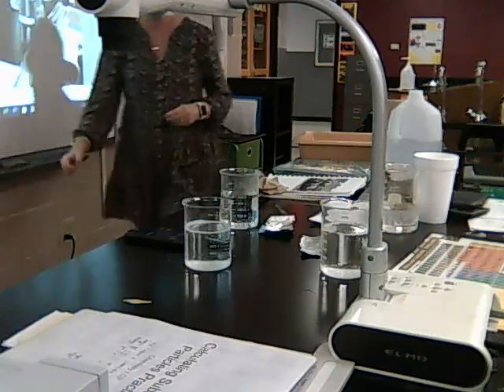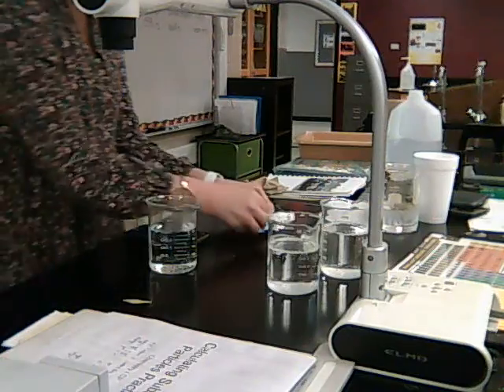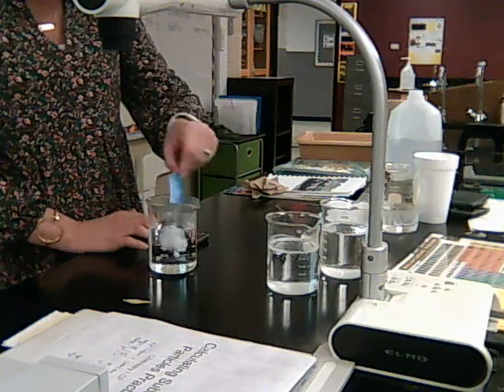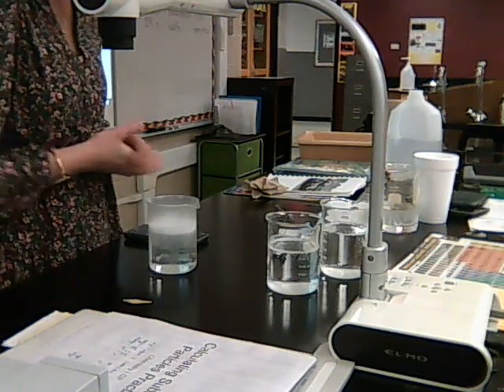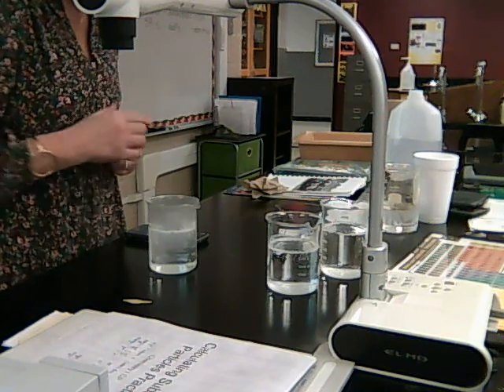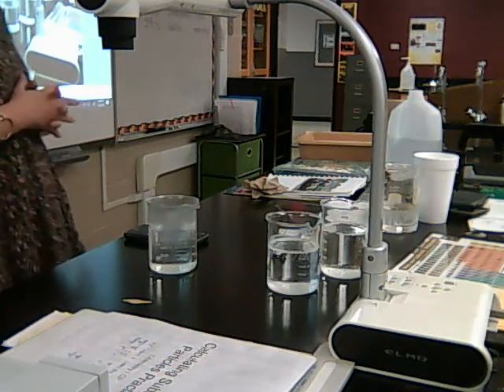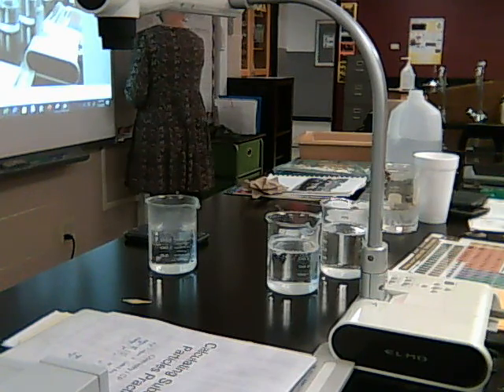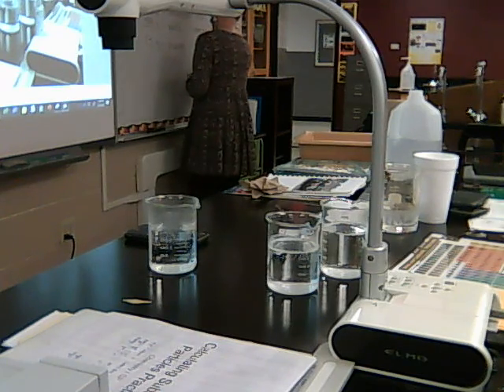Okay. So now we're going to do the hot water. And this is the one we're going to do the crushed. So I'll reset it. I'm going to put the crushed one in here. You ready? Look at those bubbles. Wow. Still a couple little pieces. 13 seconds. And this was the crushed, and this was the hot water.